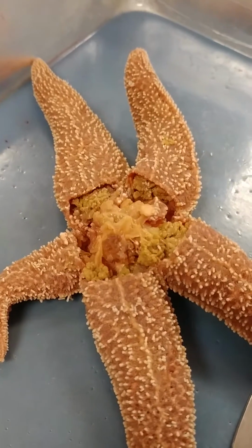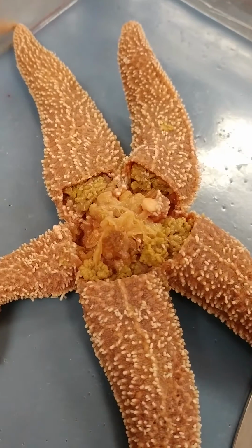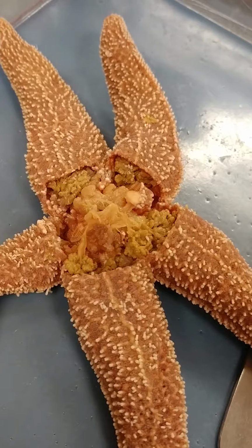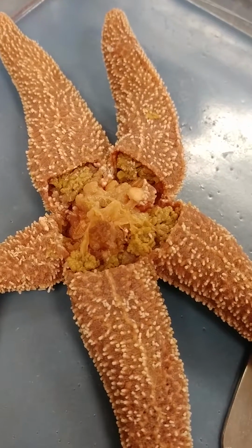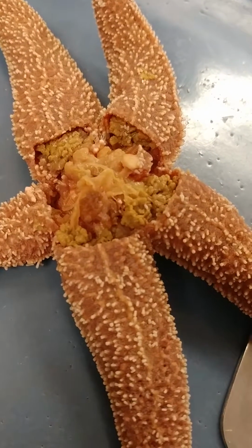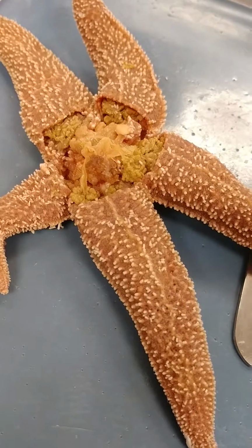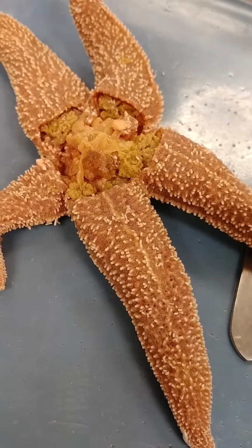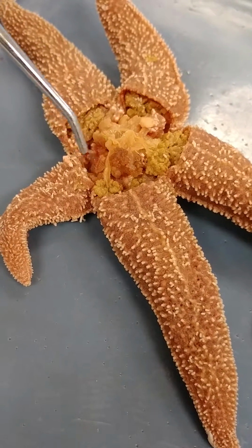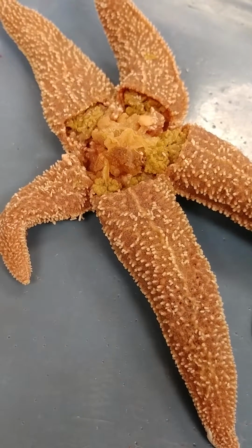So cardiac, when we refer to stomach, usually refers to the first part of the stomach, and pylorus is the last part of the stomach. So you look at your stomach, the part that's attached to the esophagus is called the cardiac section of your stomach. And the part that's attached to your intestine is called the pylorus. So remember that pyloric sphincter at the small intestine? It's named because it's attached to that part of the stomach. So anytime you hear those terms, it's referring to the stomach.